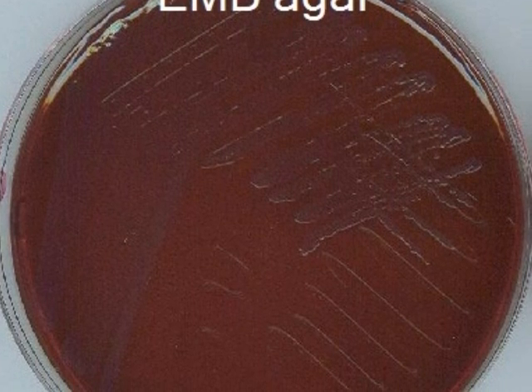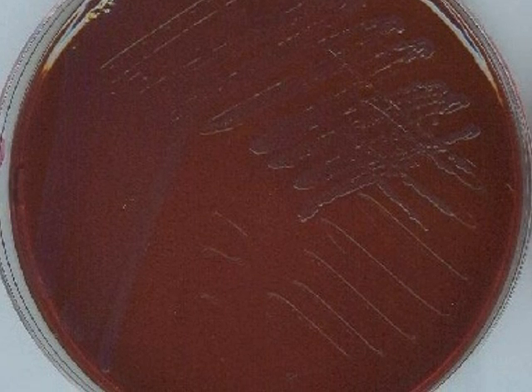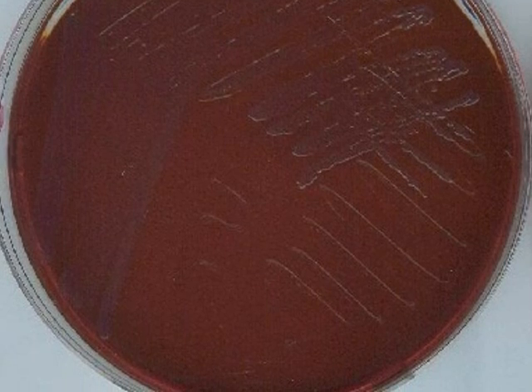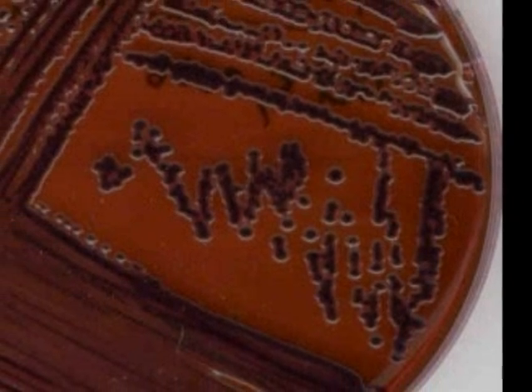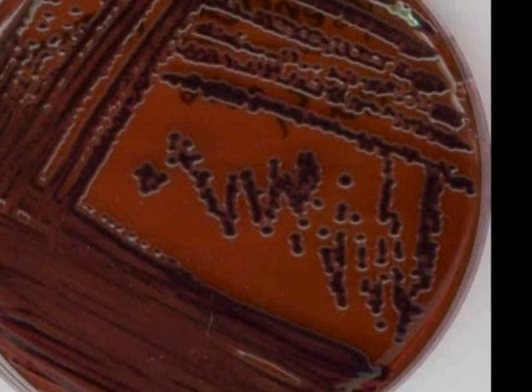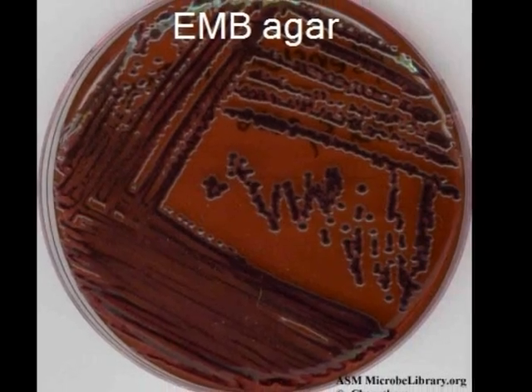There is good growth, but no color change. Your interpretation would be, the microbe tolerates the dyes present, but does not ferment lactose. The microbe is most likely a non-coliform. Notice the darkening of the growth on this EMB plate. The interpretation would be, microbe tolerates the dyes present, ferments lactose, and is most likely a coliform.